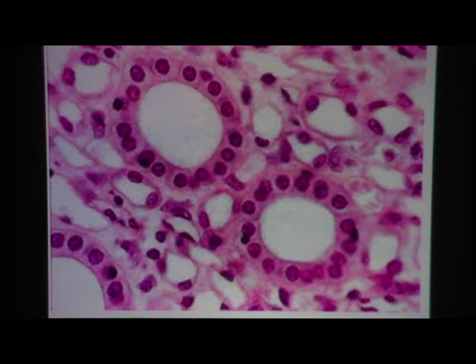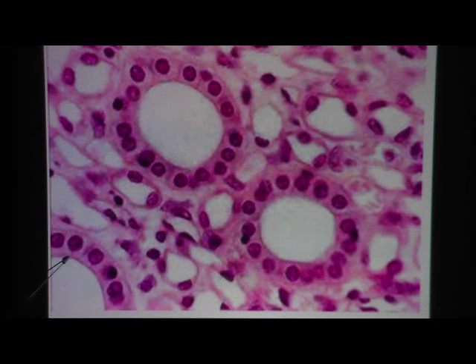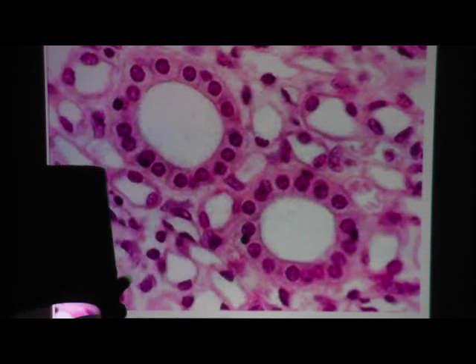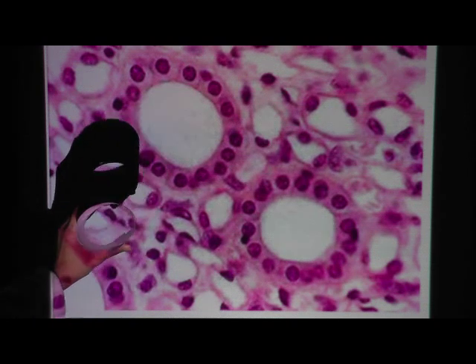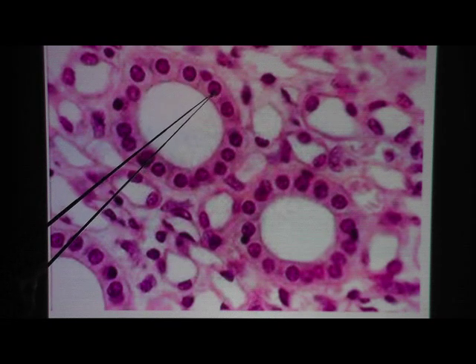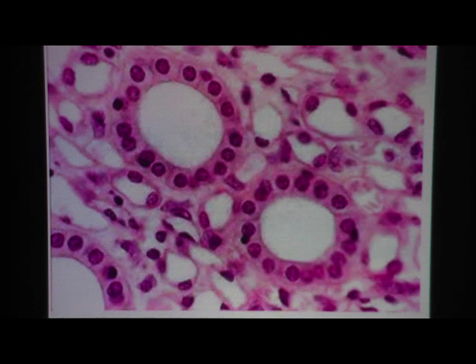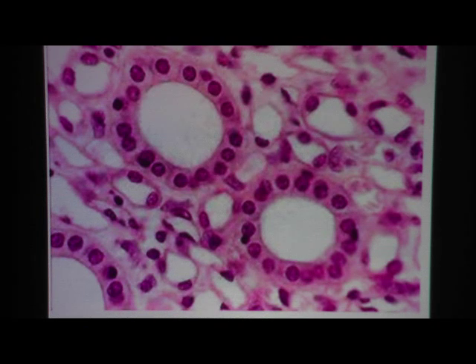Here's an image of simple cuboidal epithelium. There are white spaces visible, so all of these cells are lining tubules — round structures coming toward you. You're looking at the cut surface. There's only one ring of cells lining these round tubules, so it's one layer thick. Once you recognize a space, you should be suspicious about epithelium.